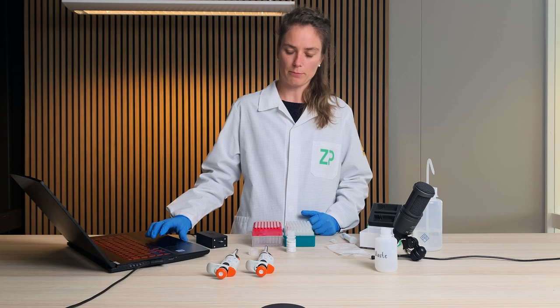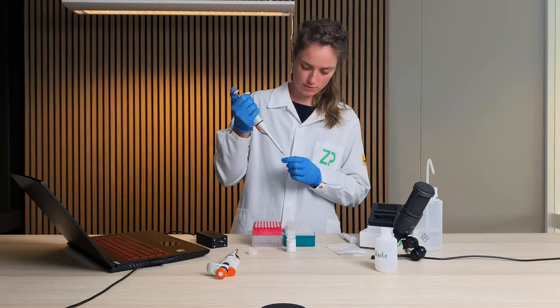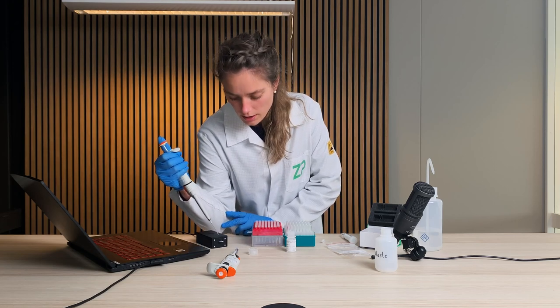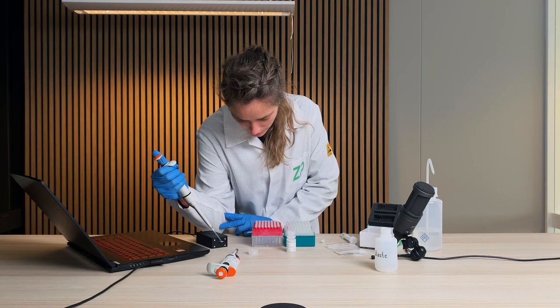Now I need to activate the sample. I do this by adding two microliters of the activation solution onto the sensor, straight into the sample that is already deposited on the electrodes. I'll make sure not to scratch the surface and try to mix it by pipetting in and out a few times, just so that we obtain a mixed sample with the activation solution.